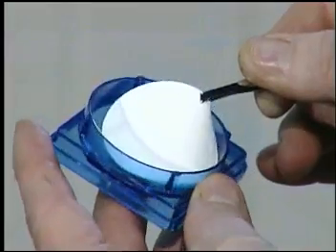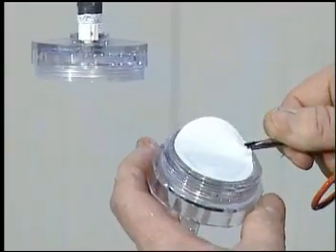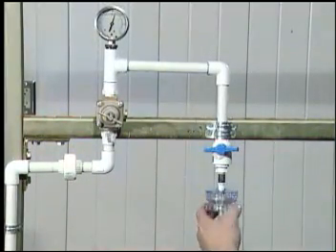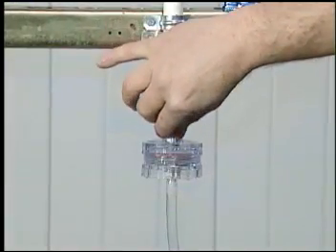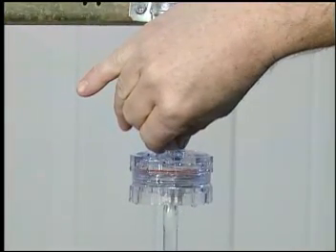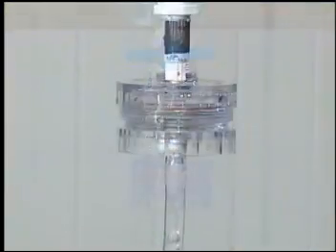A special filter pad is placed into an appropriate filter holder. The inlet valve to the filter holder is slightly opened to allow a small stream of sample to flush air out of the loosely tightened filter holder. The inlet valve is then closed and the filter holder is securely tightened.